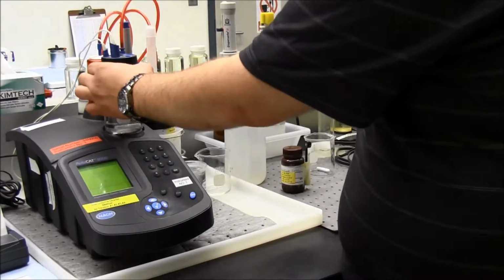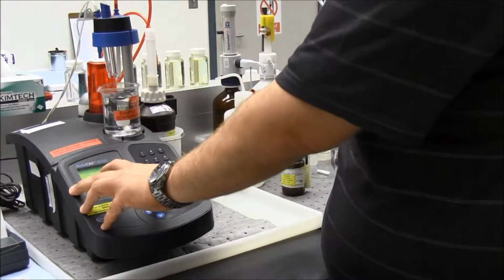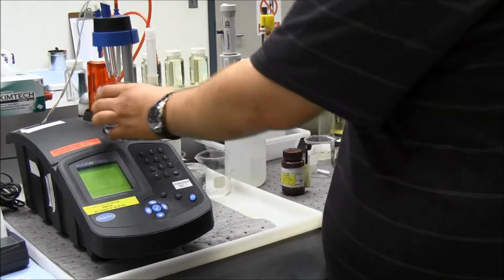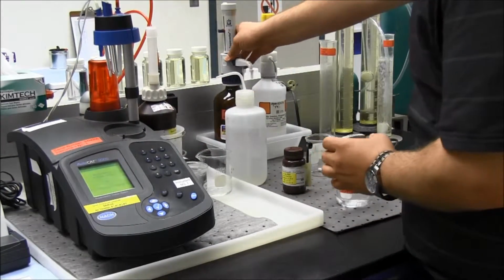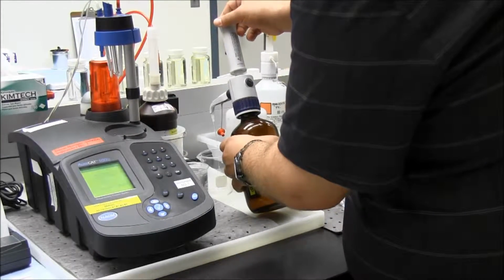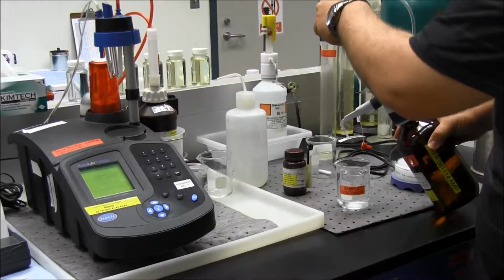So we were done with the first titration, so now we're going to start the second titration. What this screen tells me to do is add reagent 1, hydrochloric acid 2.5 normal, 2 milliliters. So I'm going to take my acid, purge the line again, just like with the phosphate buffer. I'm going to add in my acid.